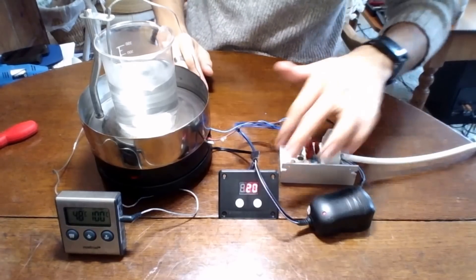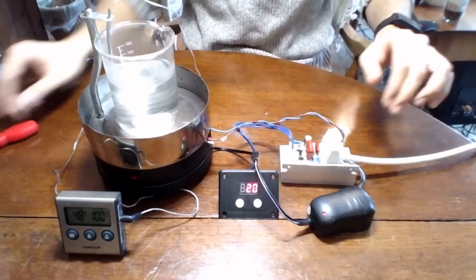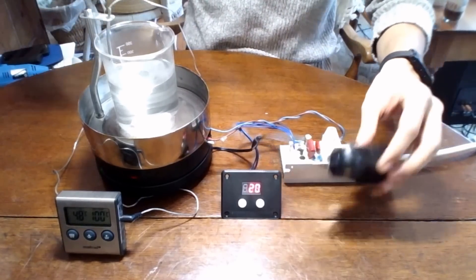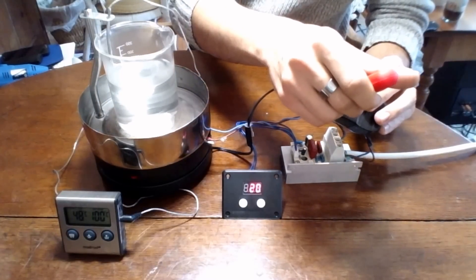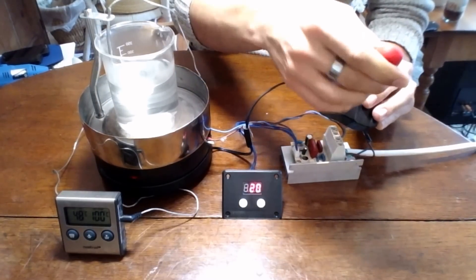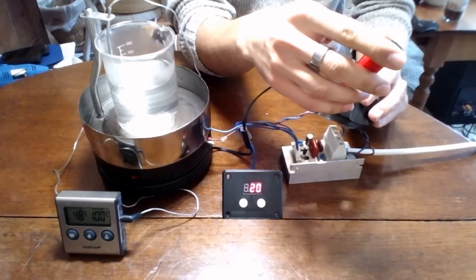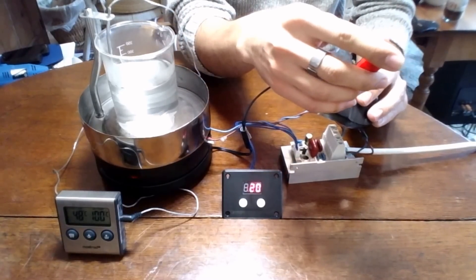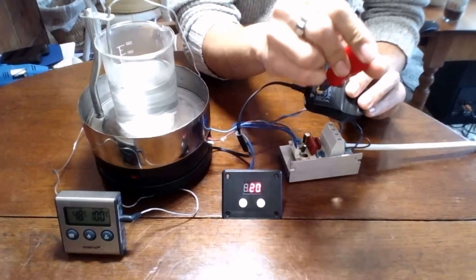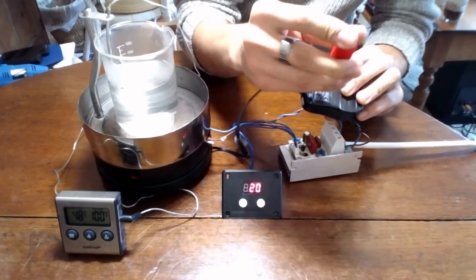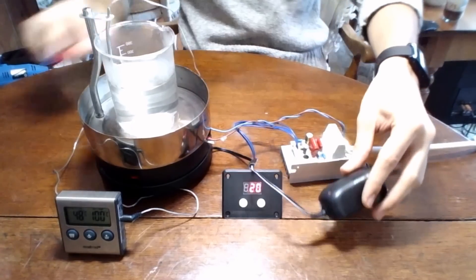Great. So we're at about 20% throughput right now. And let's just take our fan speed down a bit. We can take it all the way down to 3 volts. It spins very slowly, or all the way up to 12 volts. But we'll leave it at 9 for now.